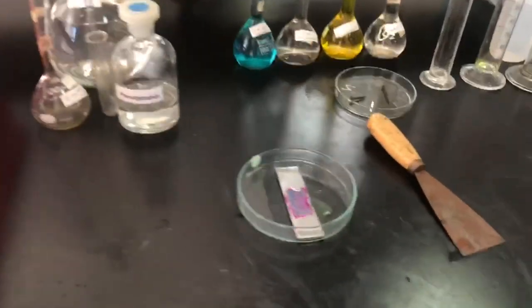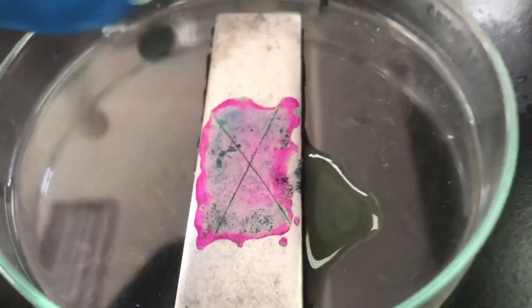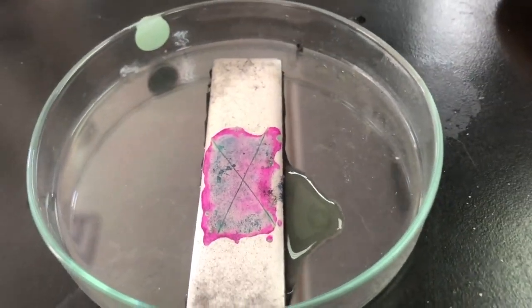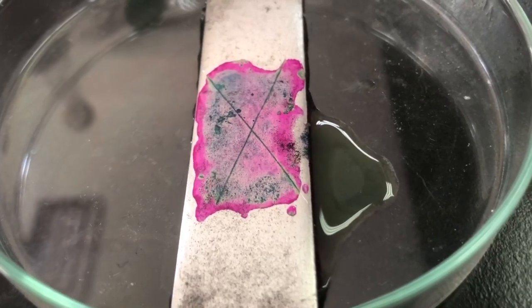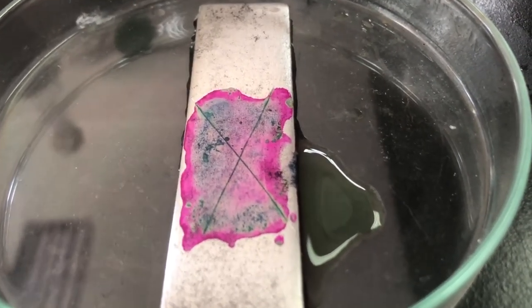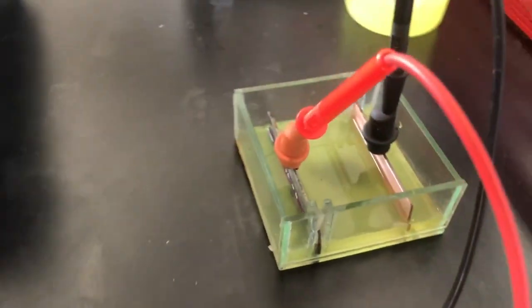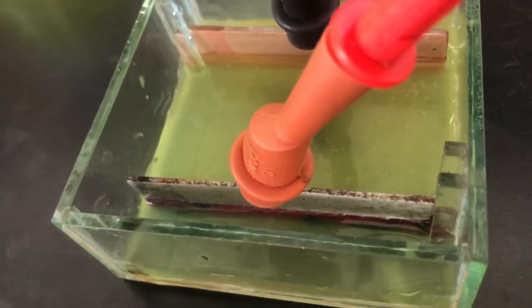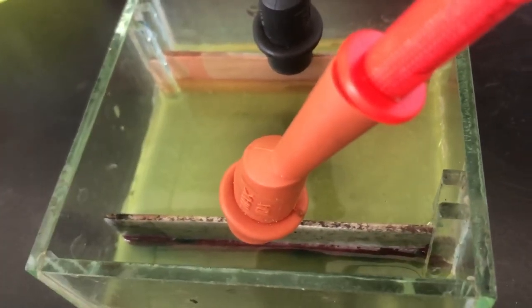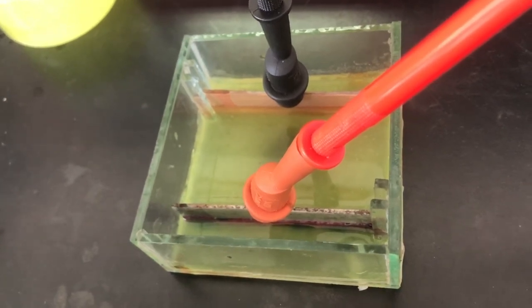Looking back at the A1 experiment, it's now more visible — the sides of the droplet are red and the scratch in the center is blue. This indicates the presence of Fe²⁺ and OH⁻ ions in the solution. In your report, discuss why these things happen and write the half equations. Similarly for A2, blue color is indicated at the iron side and red color at the copper plate, indicating oxidation and reduction during the electrochemical corrosion reaction.